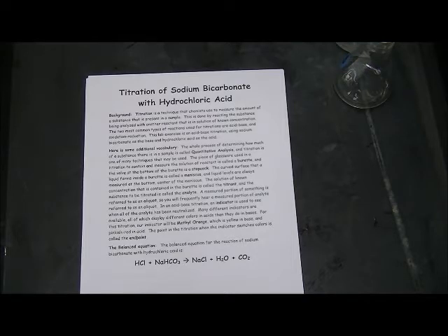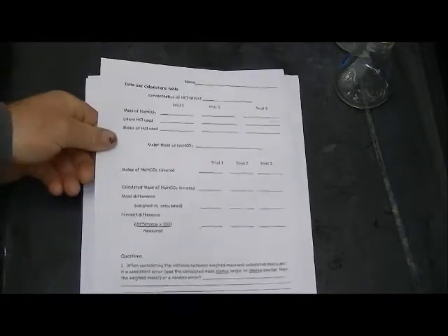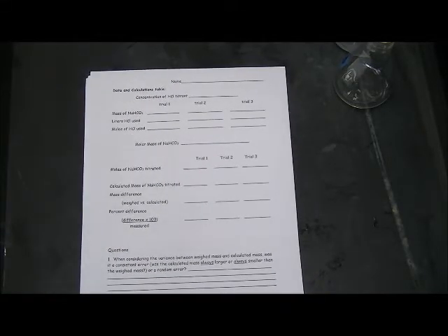We're going to perform that experiment here in the classroom and I will make sure that you guys have the data that we collect so that you can complete the worksheet for this lab which looks like this. We'll be weighing three samples of sodium bicarbonate and then titrating them and that will allow us to complete this worksheet.